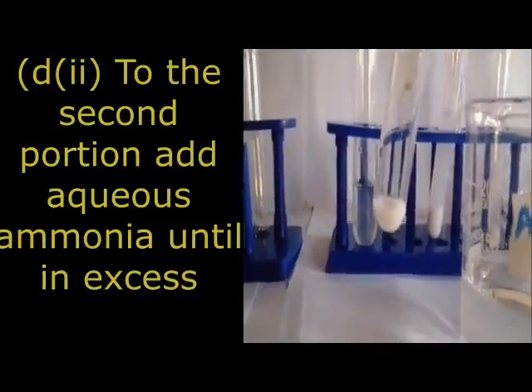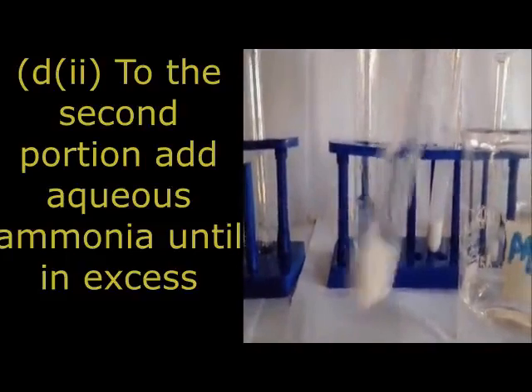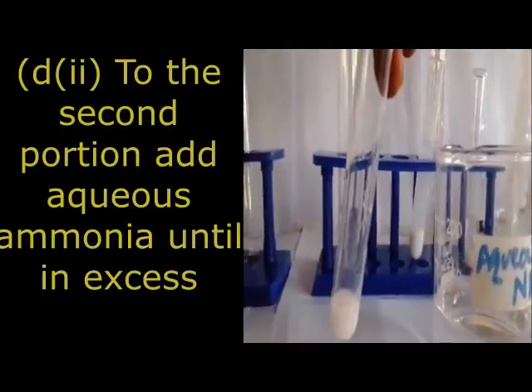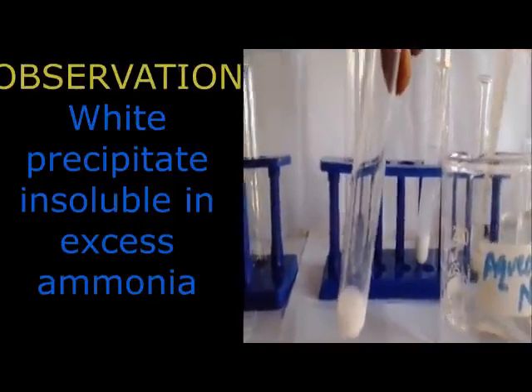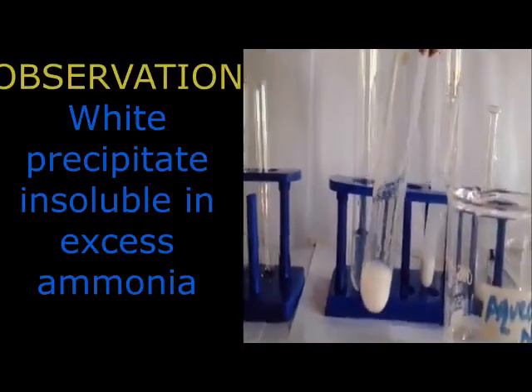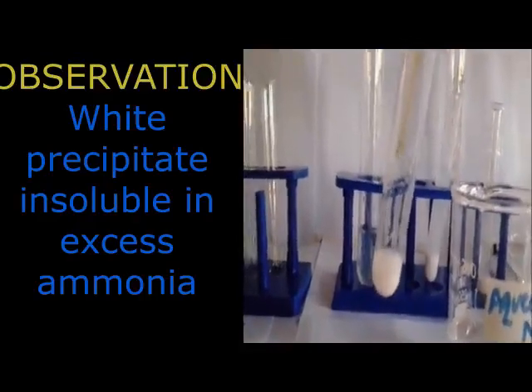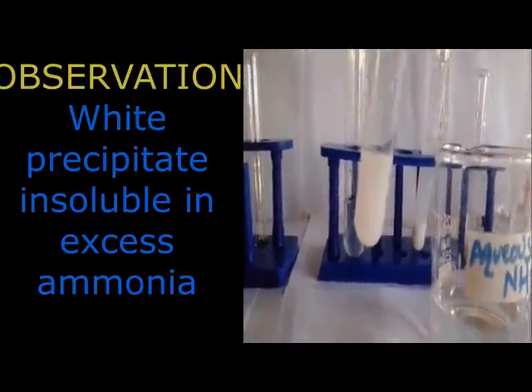When you are transferring, try to watch the first drop. There we go. With the first drop we get a precipitate, a white precipitate. Then we continue adding to look for the effect of excess. Now when you add excess, the white precipitate remains there.